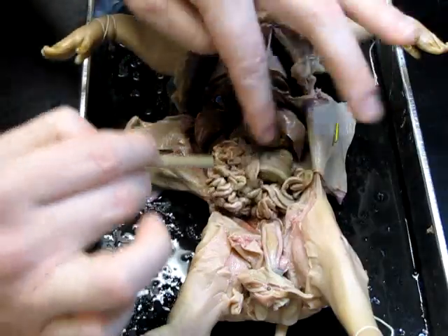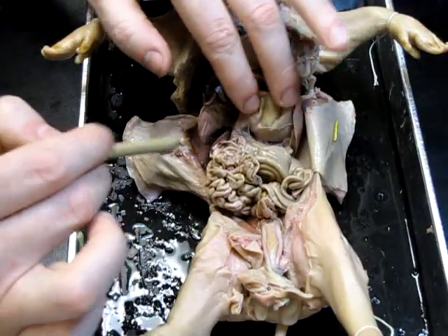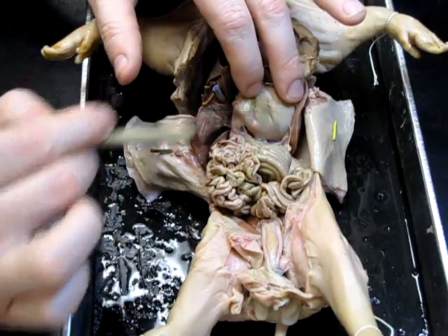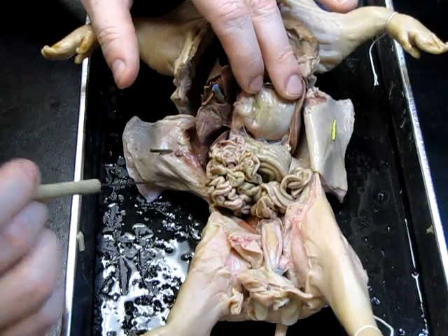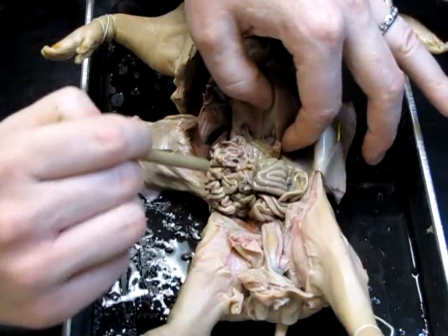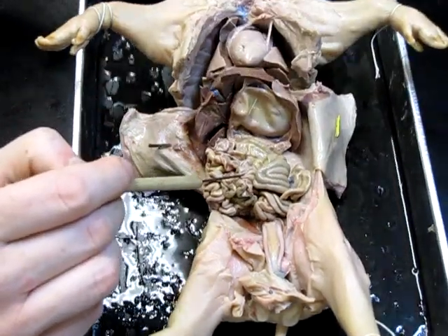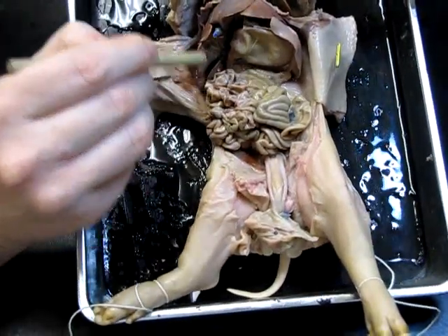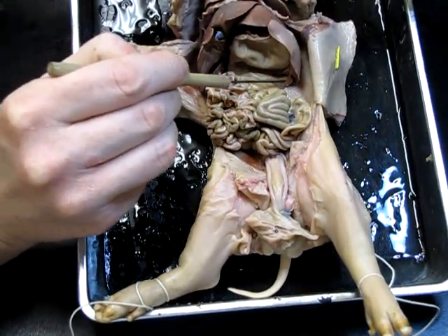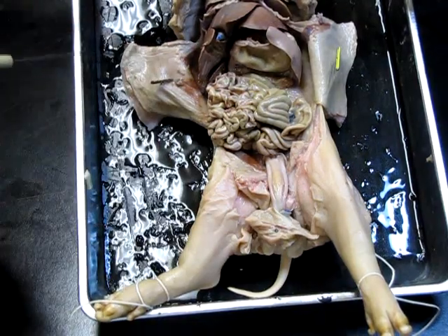Going back a little bit — in the mesentery, between usually the stomach and the first coil of small intestine, is where we can usually find the pancreas. I'll just dig down in here and lift them up a bit. This is the pancreas right here, this sort of mushy-looking glandular stuff down in here — that's the pancreas.